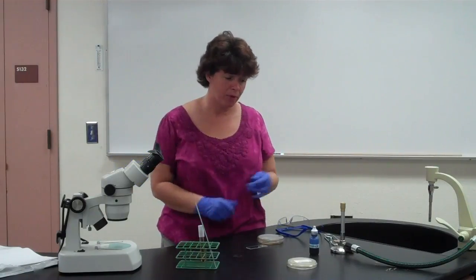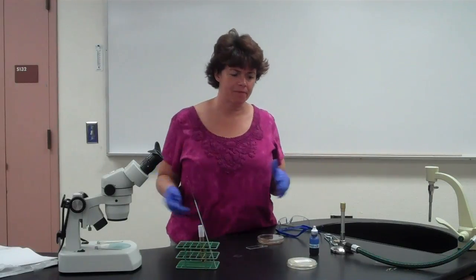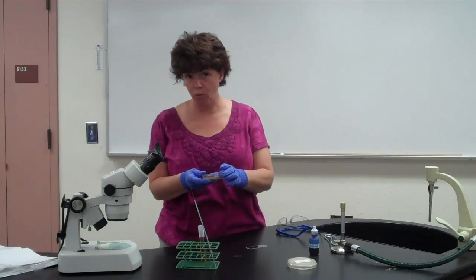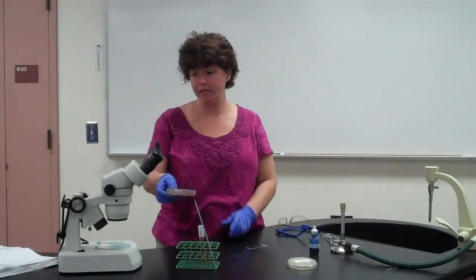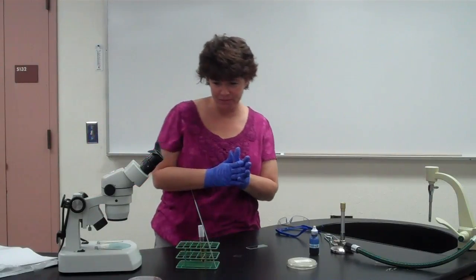The other thing that I want to point out is with this, they do have spores, so I want you to be careful as to not agitate everything too much. You don't want to break the spores and have them going up in the air and things like that. So that's for the inoculation of the plate. And for this one, we're going to put it in the incubator at 25 degrees for a week. And just like we did with the yeast, you're not going to invert it, you're going to leave it right side up. Okay? That's the first day's procedure.